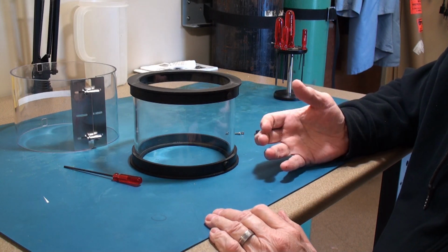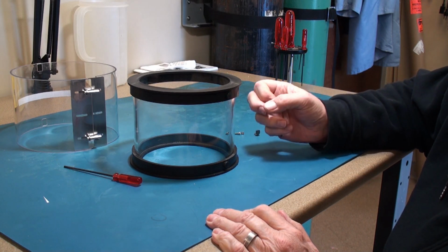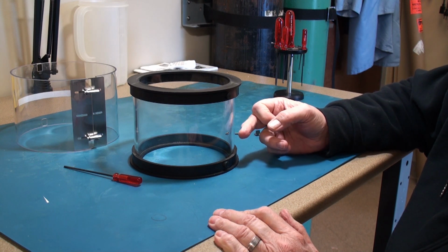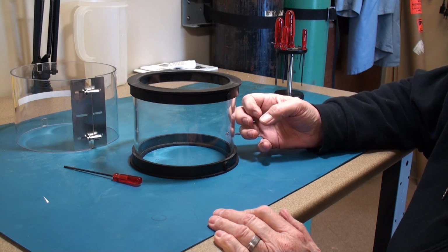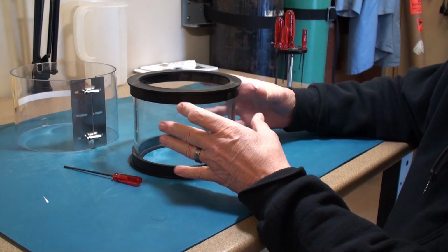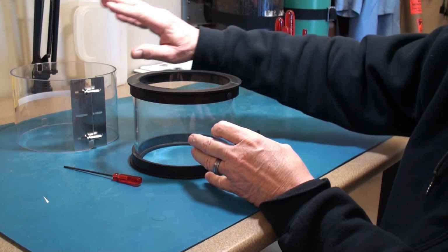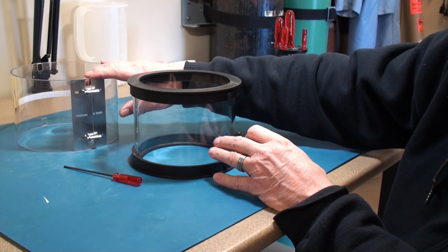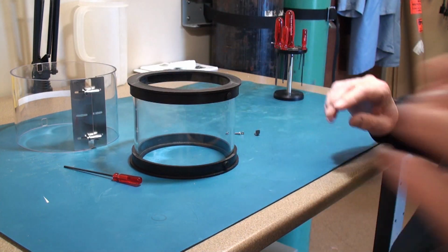This is to protect you in case something hard bumps into the glass cylinder in the chamber. When it's under vacuum, this will implode because of the pressure differential, and it will all be contained in this Lexan cover.